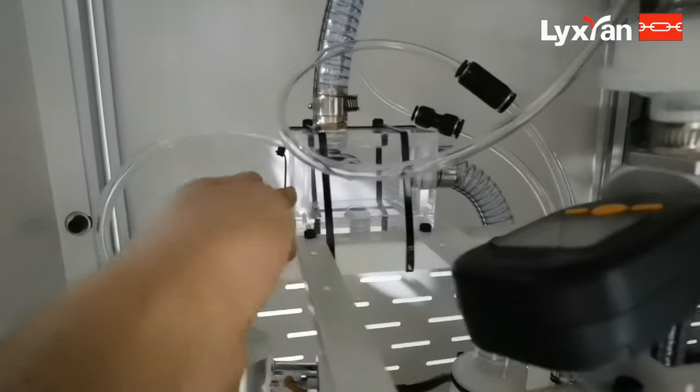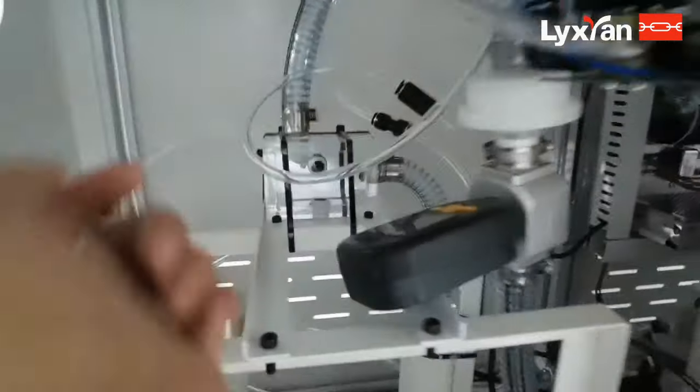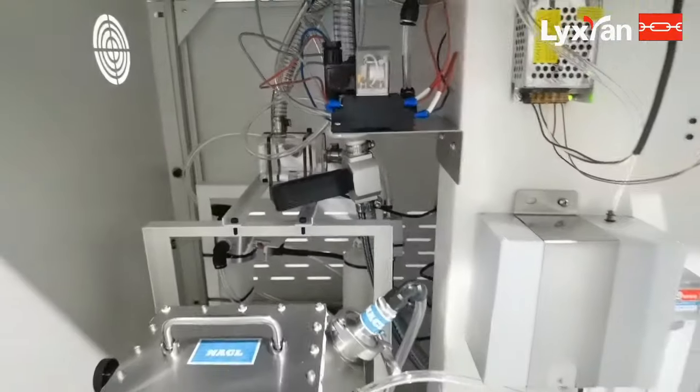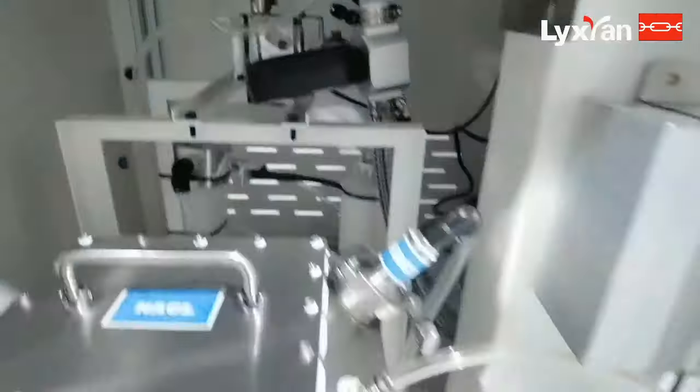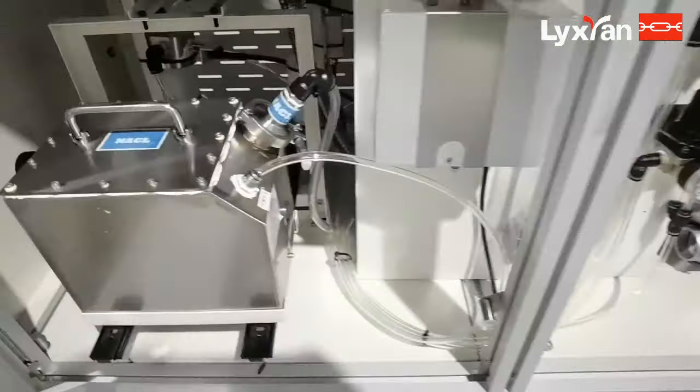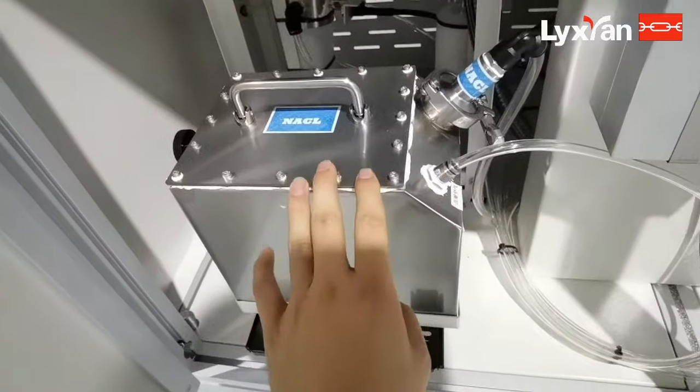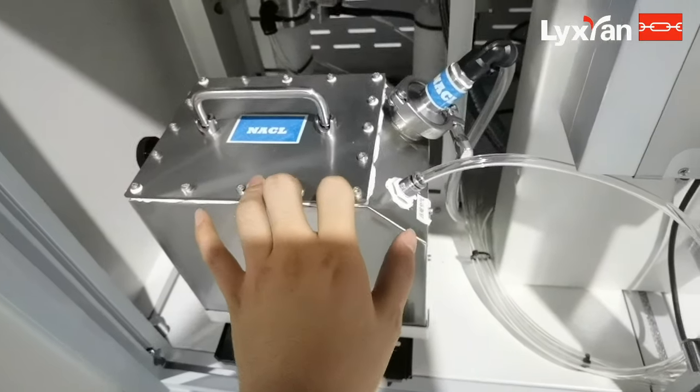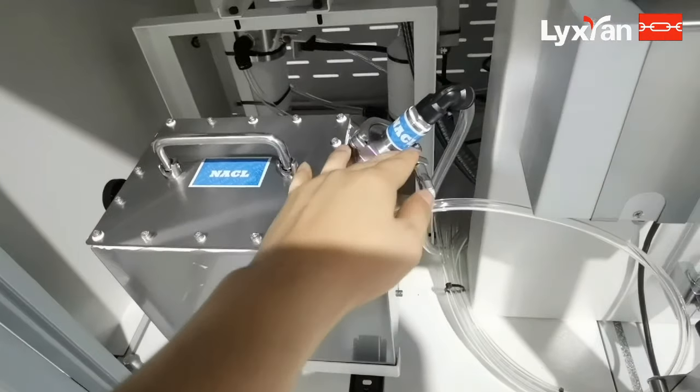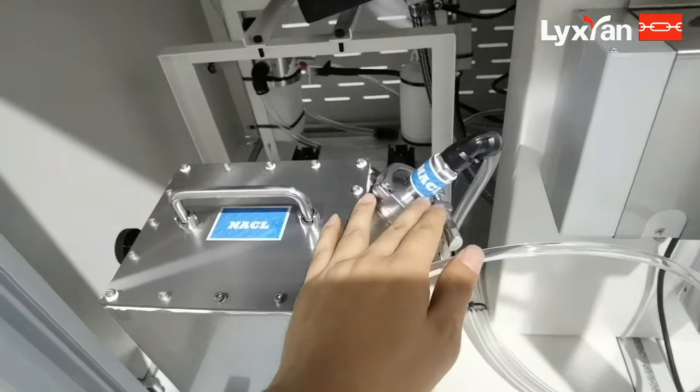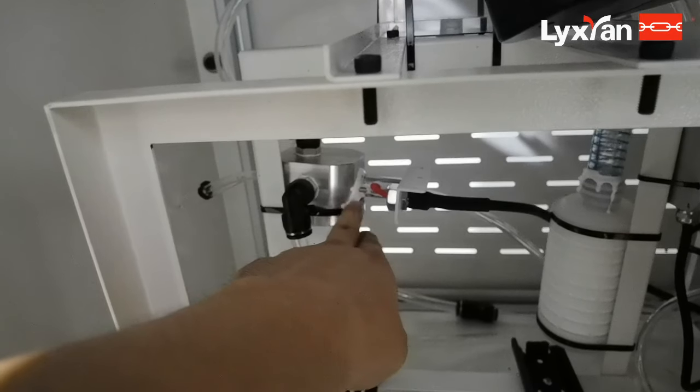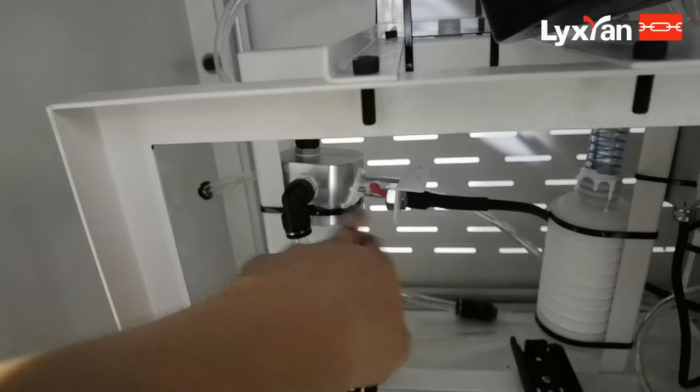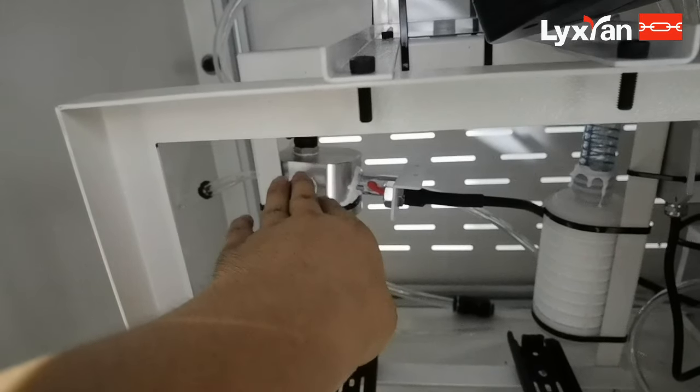And here is a mixed chamber. This is a meter. So when the generator produces a lot of particles, they go through here and get into this small chamber, and here we have an electric heater to heat the particles.